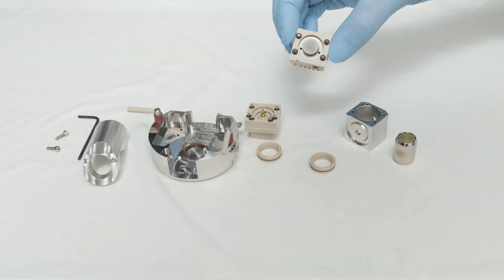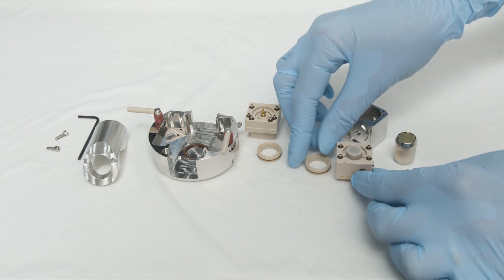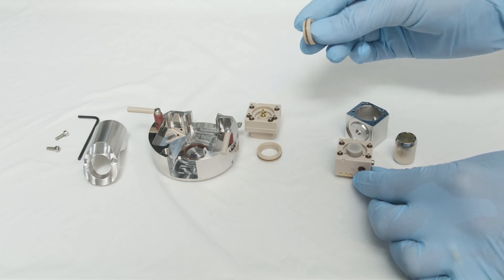Once dry, the electrode assembly can be put back together, making sure the bushings are in their correct placements.